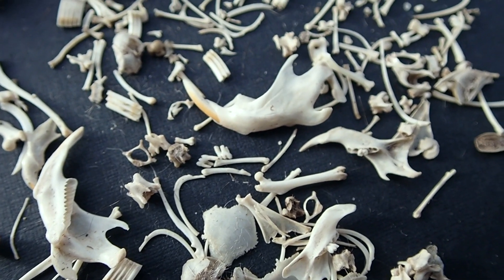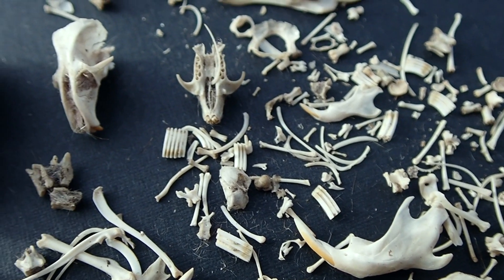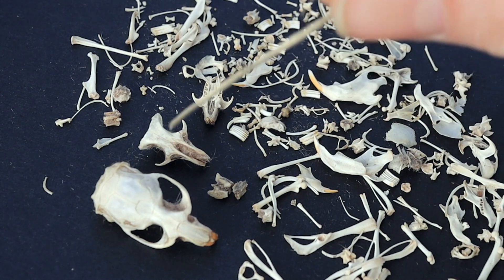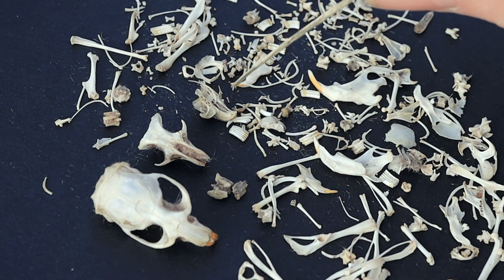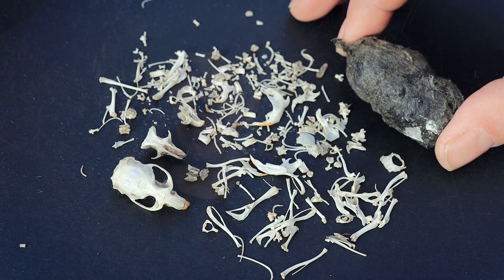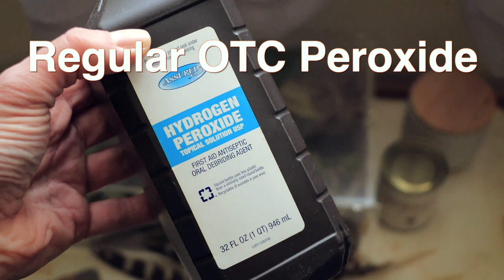What's really cool is one pellet can have the remains of one or three or even four food items. In the Pine Barrens they'll have not just mice and shrews but maybe little snakes or lizard skeletons in them — I've got to find one of those. I learned that I had the remains of three different rodents in just this one barn owl pellet, which is really cool. So if you're into dissecting owl pellets and you want those bones to come out nice and clean so you can show them to people, try soaking them in some hydrogen peroxide because they came out beautiful.